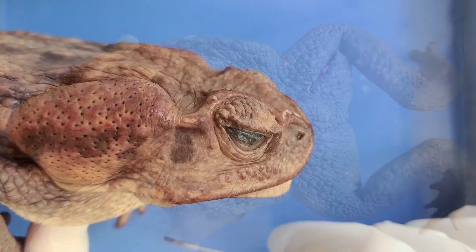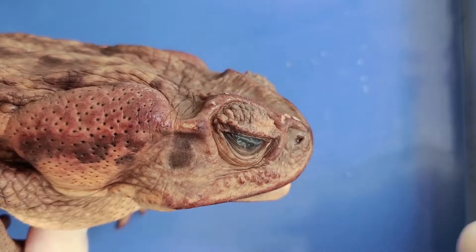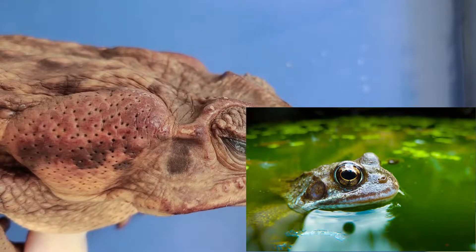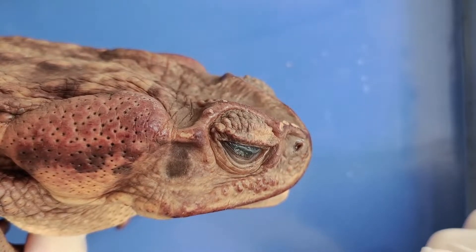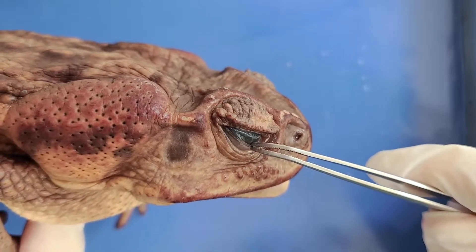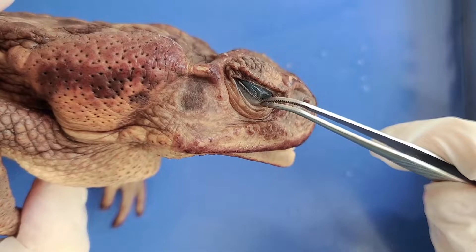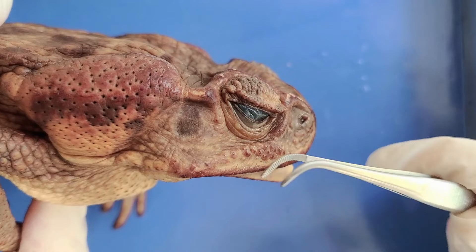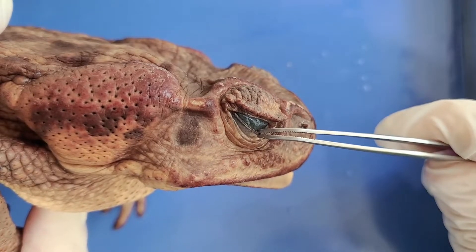Now let's look at the anterior side. The eyes and nostrils of a toad are on the top of its head so that it can see and smell even while most of its body is underwater. You can also see the eyes of the toad are covered by this thin transparent film, which is called the nictitating membrane — also called the third eyelid. It's drawn across the eye and functions kind of like swim goggles. I'm holding the membrane right now and it's drawn up halfway across the eye.